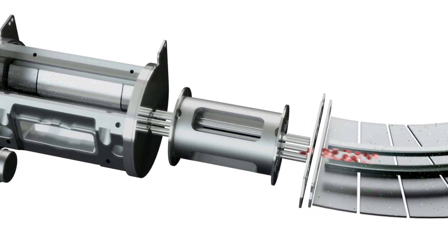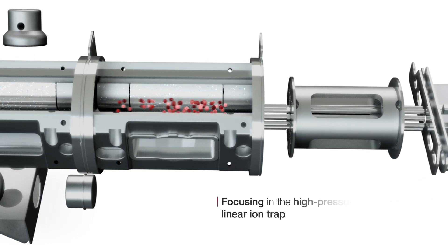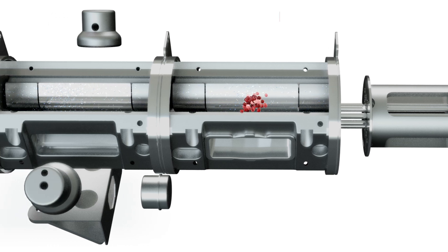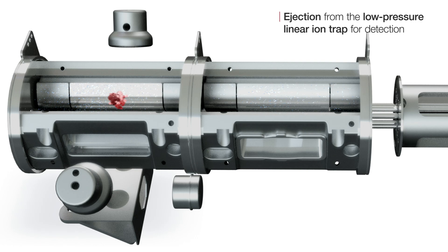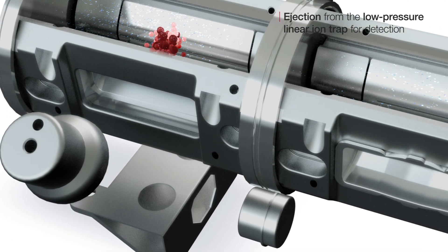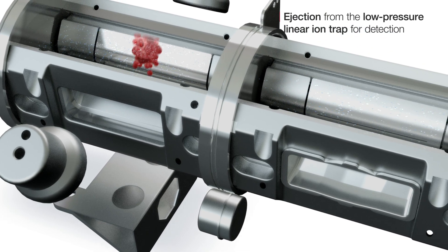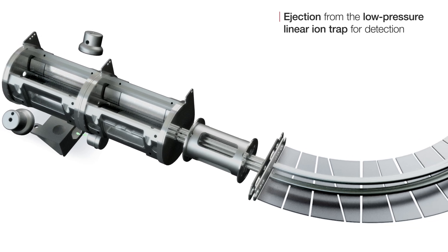Product ions are then packaged for synchronized transmission to the dual pressure linear ion trap. In the high pressure linear ion trap, product ions are collected and cooled in the center and then transferred to the low pressure linear ion trap and ejected to the conversion dynodes for detection. The newly designed ion path in the Stellar Mass Spectrometer allows full-scan MS-MS spectral acquisition at speeds up to 140 Hz — unprecedented speed for biomarker verification.